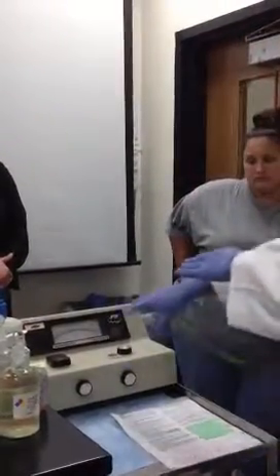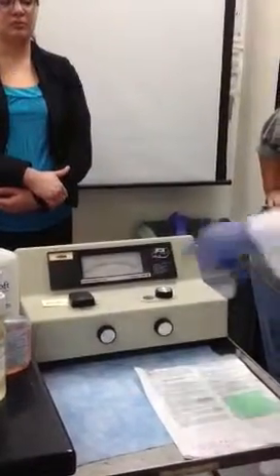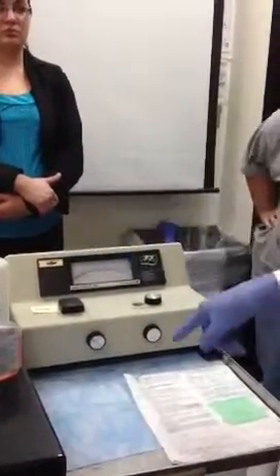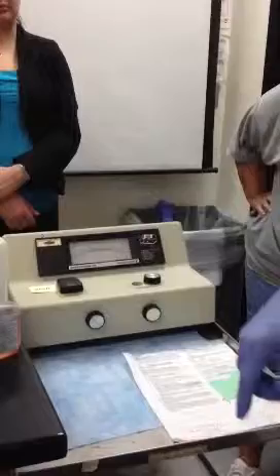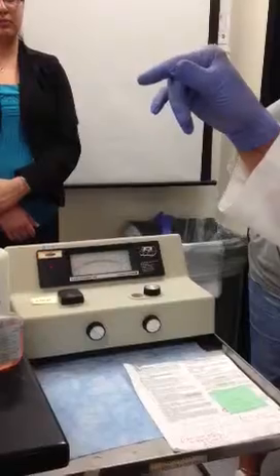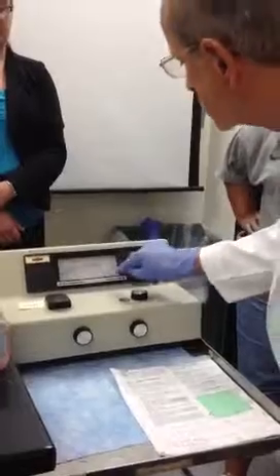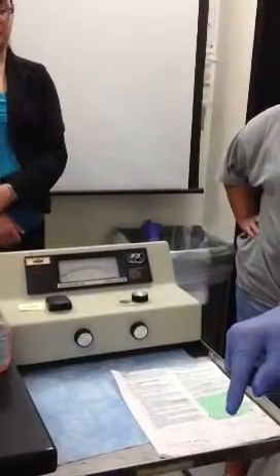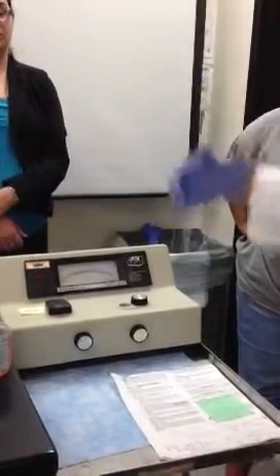Now, my needle right here on this gauge is reading 100% transmission. That's the top set of numbers. The bottom set of numbers reads absorbance. Another way of expressing absorbance is optical density. So I'm reading 100% transmission of light on the top scale and 0 absorbance on the bottom scale. See, they're inverse of each other. You with me? All right. So now my machine is 0.